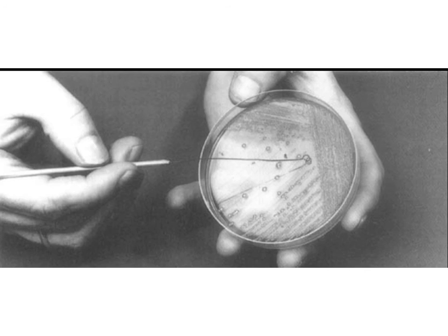Before you pick up any of your bacteria, you want to make sure that this loop has cooled down. Failure to cool down means we'll basically be killing the bacteria with the heat of the loop. You can just hold it and wait until it cools down. You don't want to touch it to the table, to your hand, or to anything.